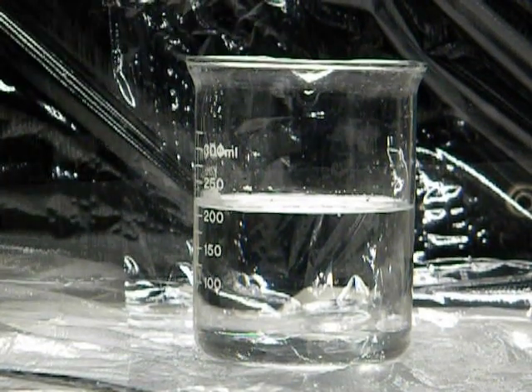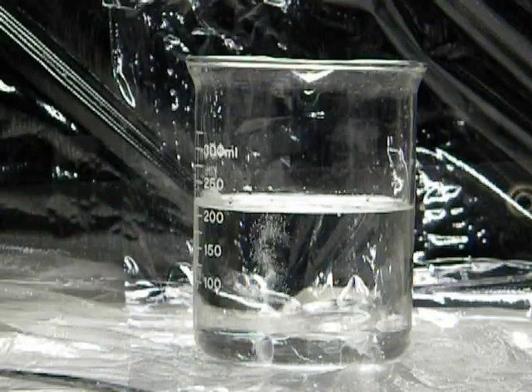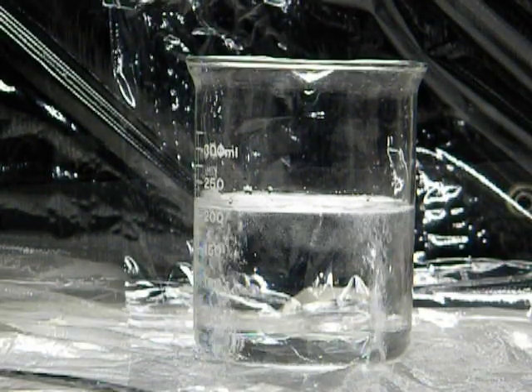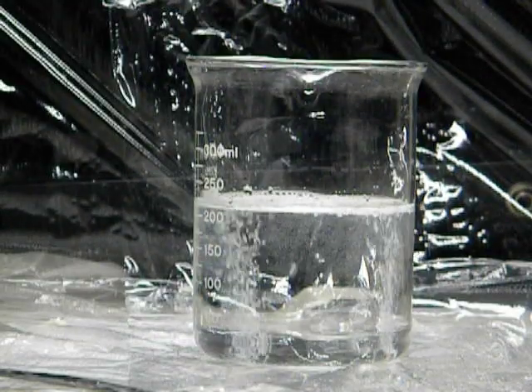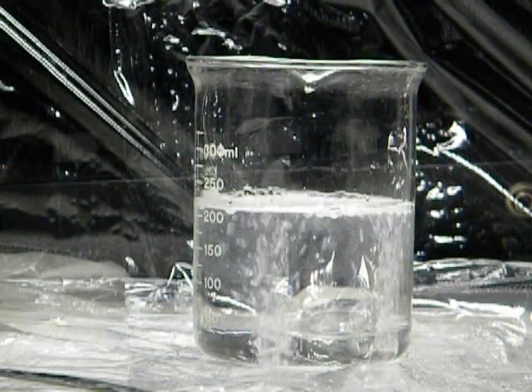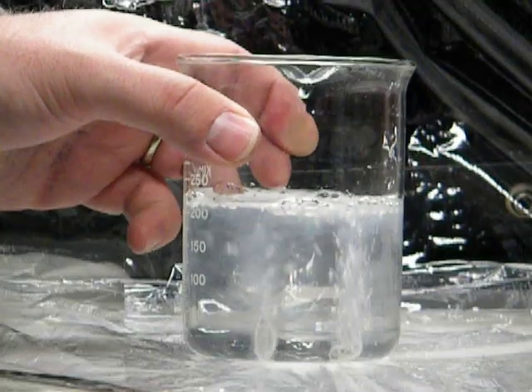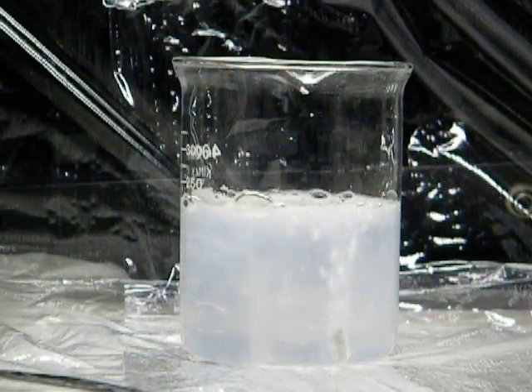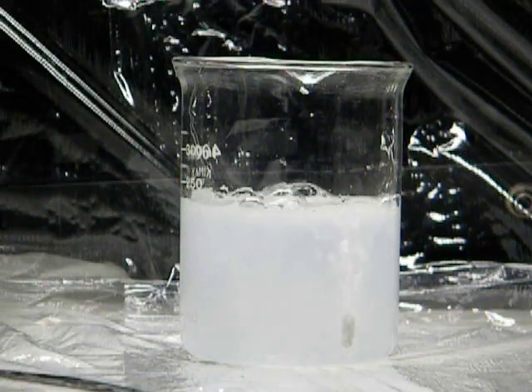Let's drop calcium metal into water. You can see it bubbles. It bubbles kind of rapidly, so you can see your first chemical reaction of the year there.